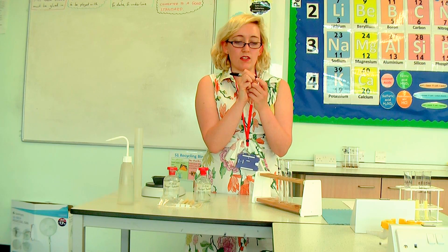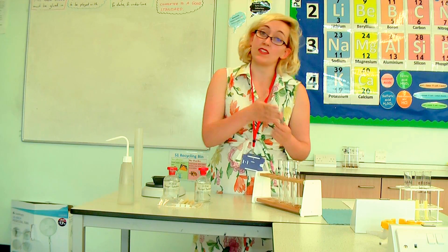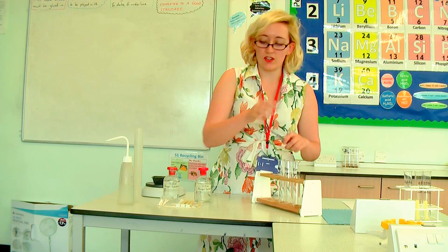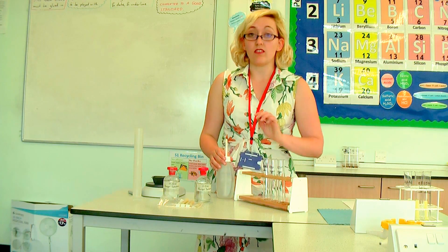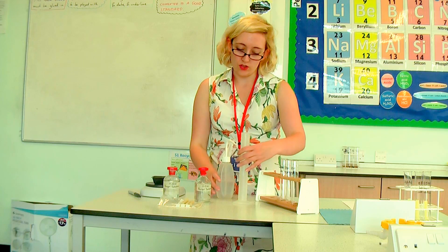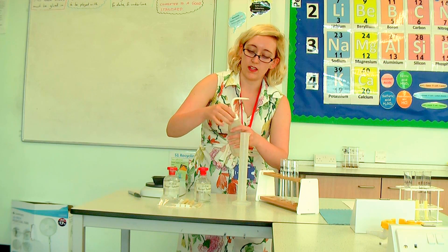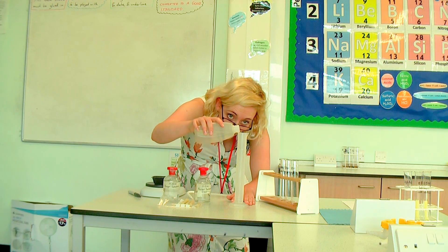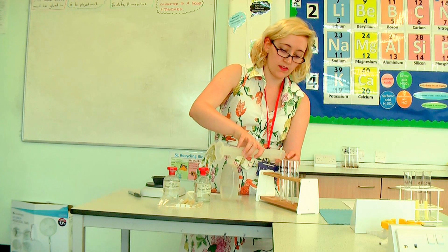And the last one I'm going to label as 0.5 M sugar. If these were dangerous I would also be writing on any hazards associated with it, just to make sure that when someone else looks at the test tubes they know what's inside them — we don't want anyone thinking it's pure water and ending up with a face full of acid. So we always label our boiling tubes. How much liquid you put in depends on the size of your potato chips; you want an amount that's going to exactly cover your chip. I found that about 25 mils covers very nicely.